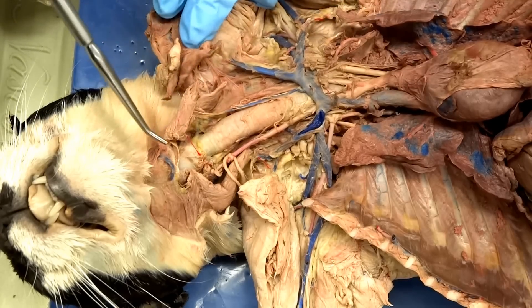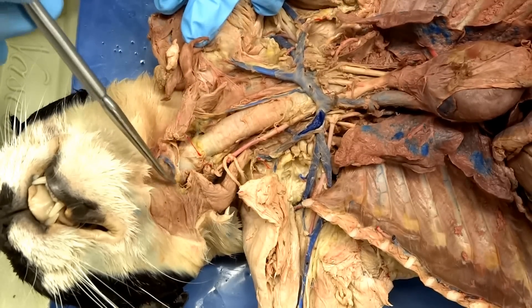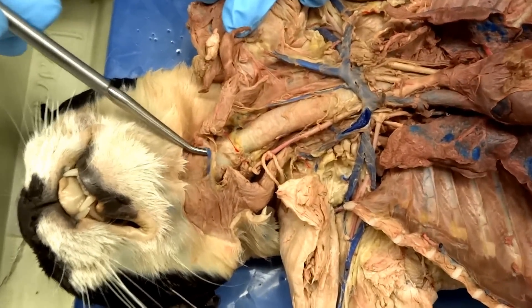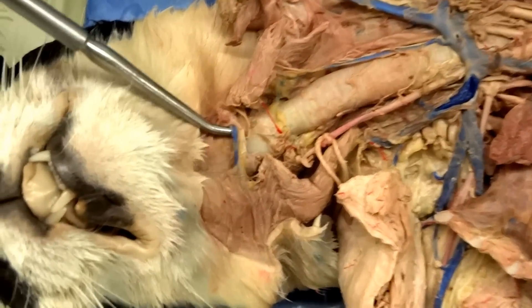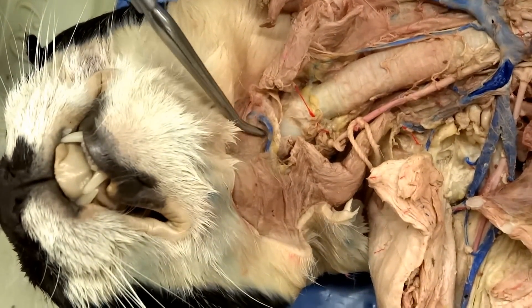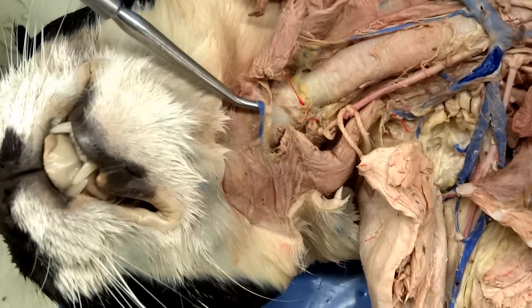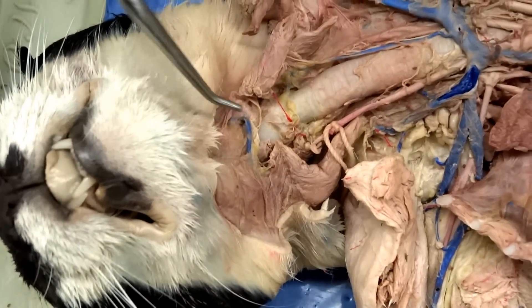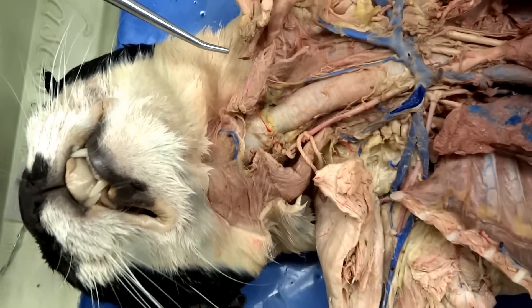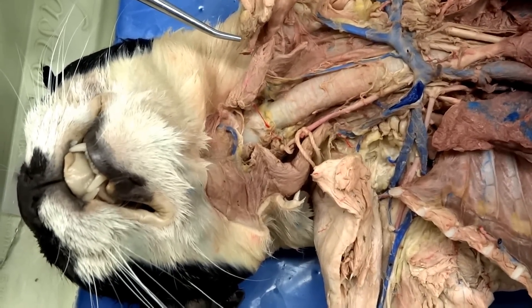We have one little vessel up here — that is our transverse vein. The transverse vein does not occur on humans; it's very unique to the cat. I think we got it. We'll do our second one for the lower.